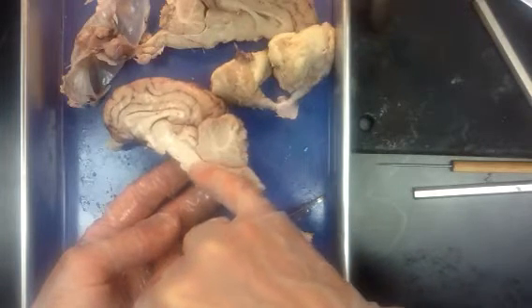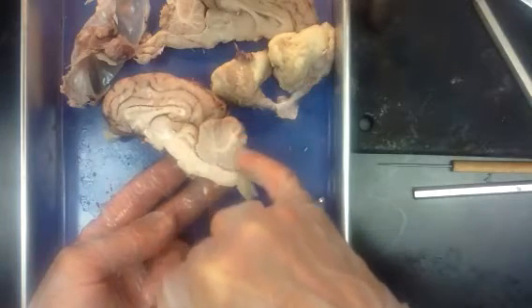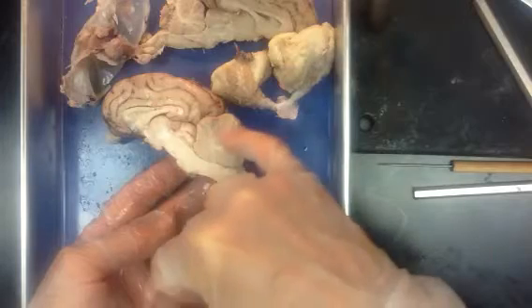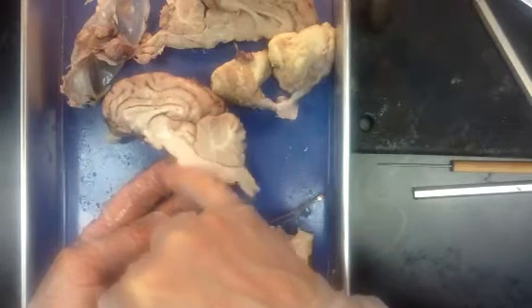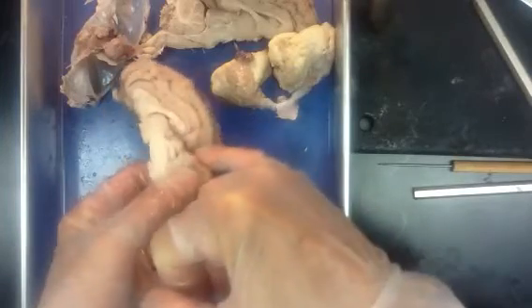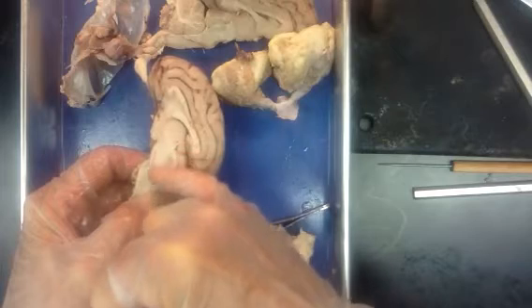They're neighbors. I like to think of the cerebellum as the mansion with all the rooms where you store information, and it looks out over the pons. It looks down its lawn and across the lawn to the pons, so you can remember they're right next to each other. The next section moving up the brainstem, and in terms of development, the next section that develops in the brainstem is the midbrain.